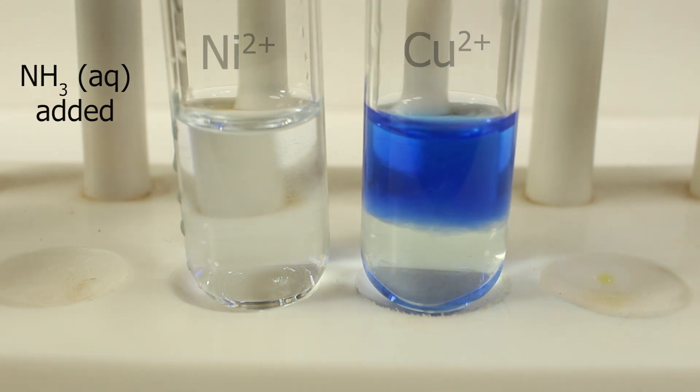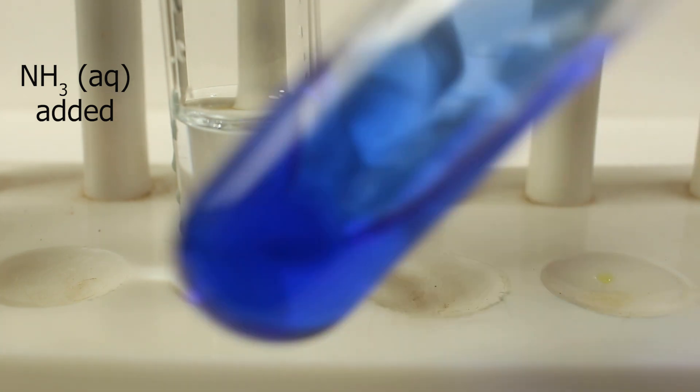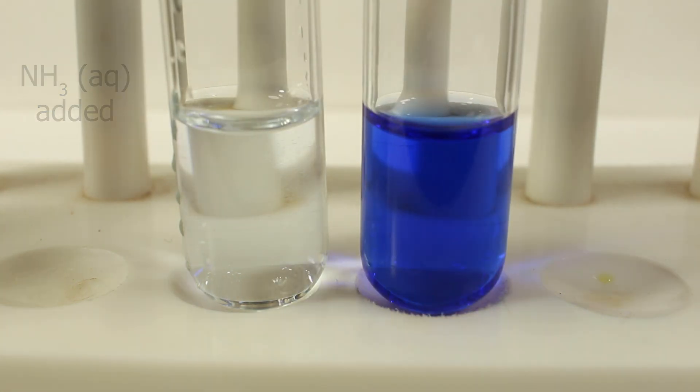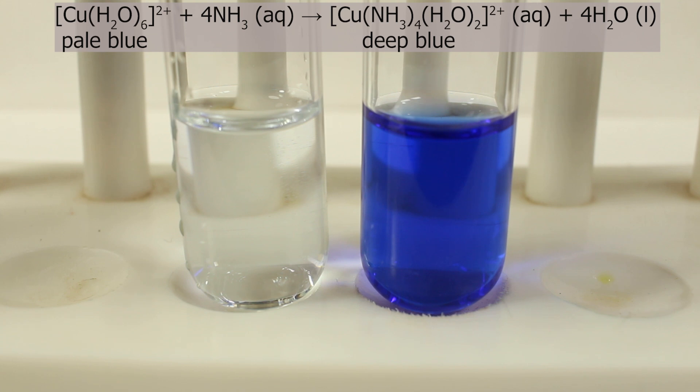On the borderline you can see precipitate of copper II hydroxide which disappears on shaking. Now we have tetraammine diaqua copper II deep blue solution.